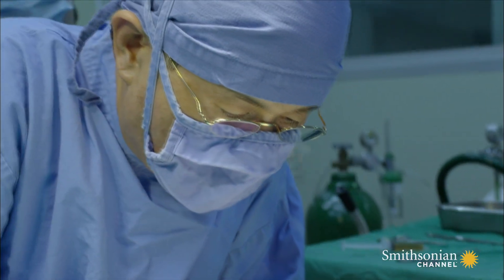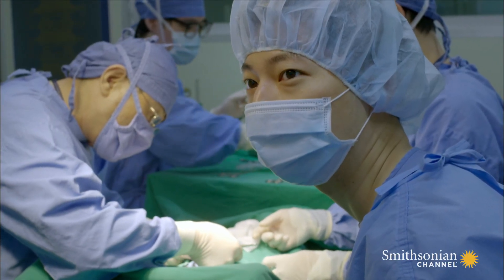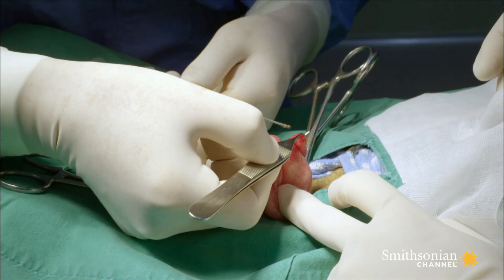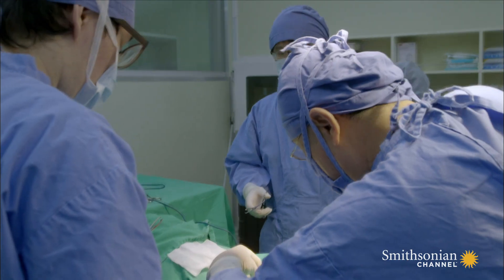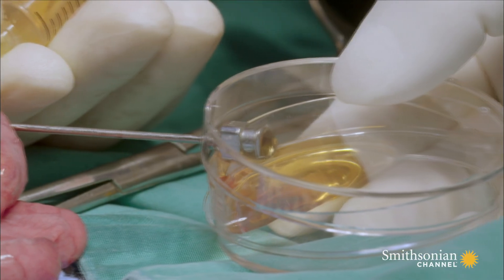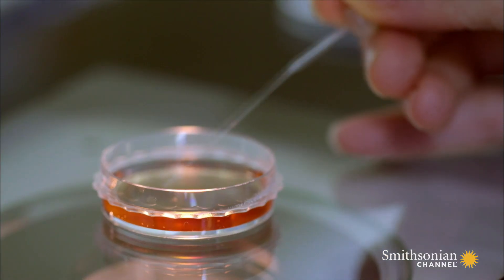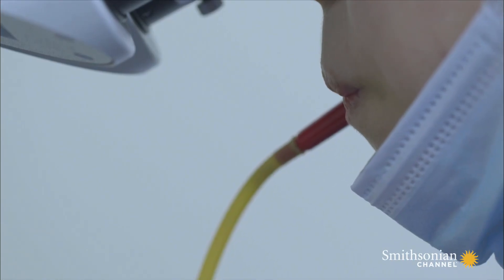They need to put the cell into an empty egg. So this is the step where we extract eggs out of the egg donor. In a harmless procedure, eggs are removed from a sedated mongrel dog. They're going to flush the medium through the oviduct, and then the eggs come out the other way. Our researcher is working with the liquid extracted from the oviduct of the domestic dog, using a very small mouth pipette to pick up the eggs among all the debris.